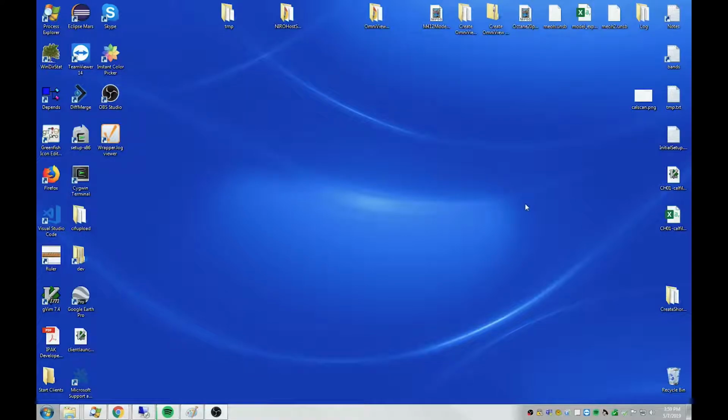In this video, I'm going to show various ways to start an OmniView client. OmniView is a server client program. It runs on the computer inside the cabinet of a NIRO analyzer. To use OmniView, you start a client and interact with the analyzer using that client.